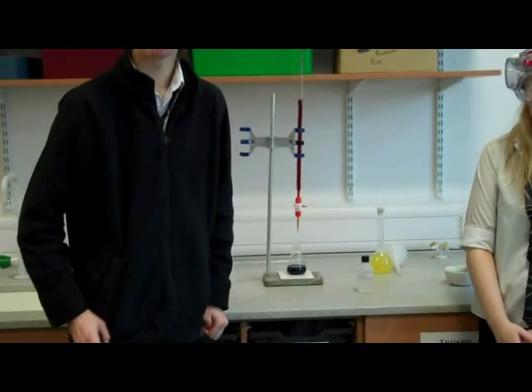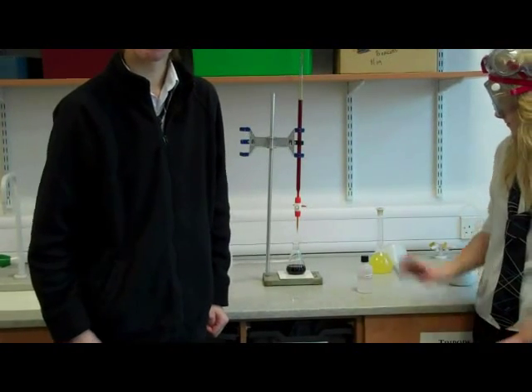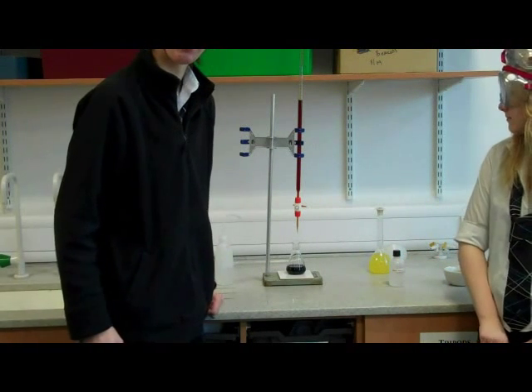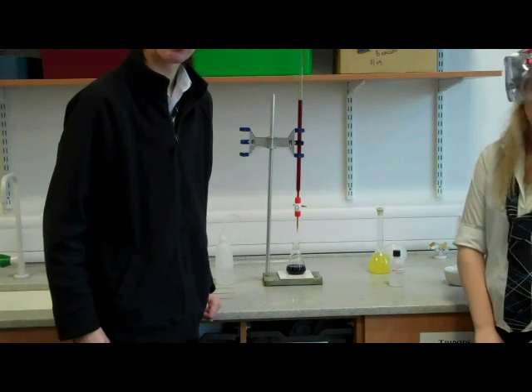Once the solution turns black, take the measurements of the final reading on the burette. 34.5. You will repeat this twice.